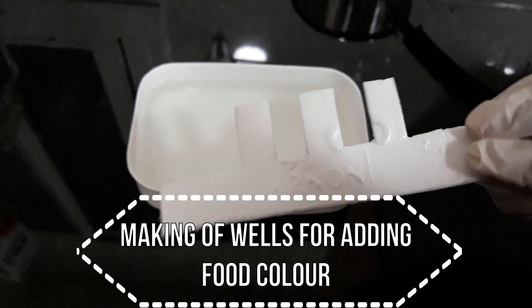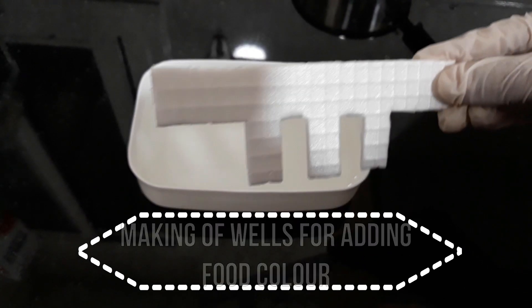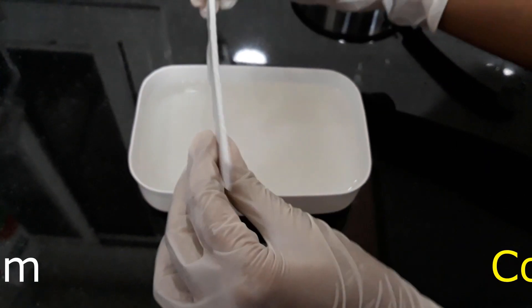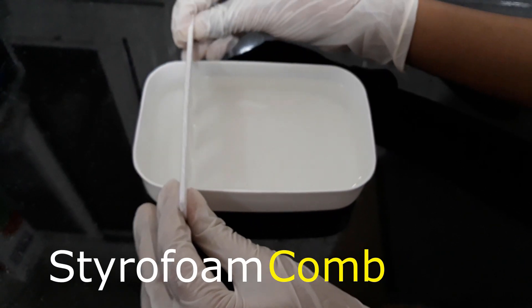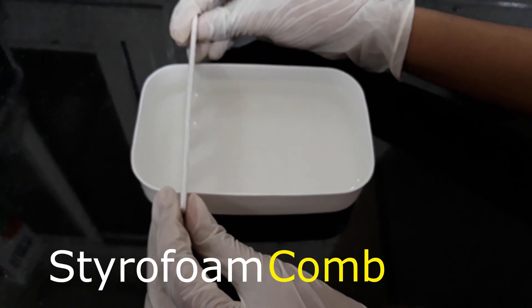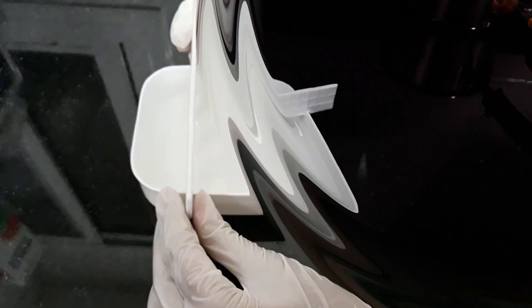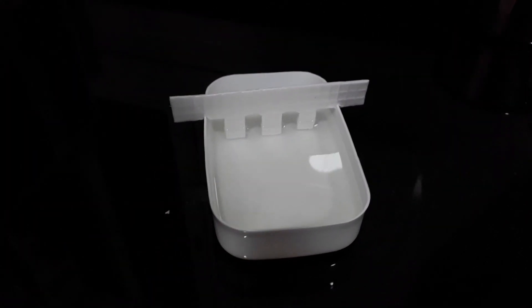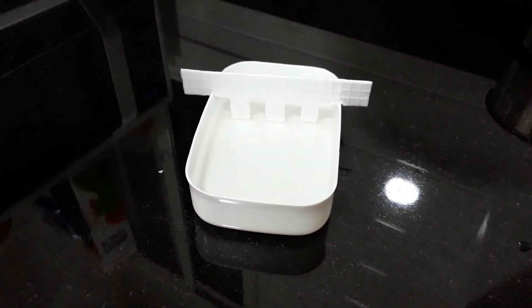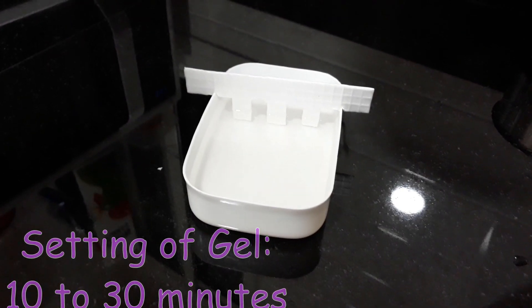For our wells, we are going to insert a styrofoam comb having 3 evenly spaced teeth into the hot solution. Make sure that the teeth do not touch the bottom. Now, we have to wait for the gel to set which can take about 10 to 30 minutes.